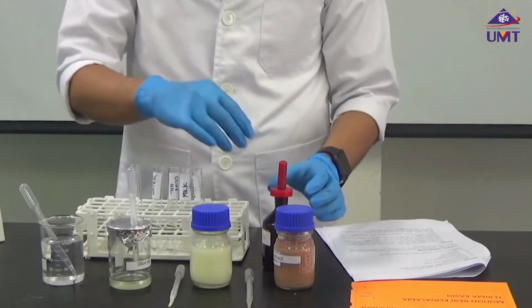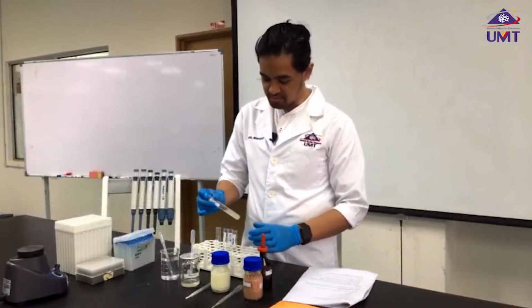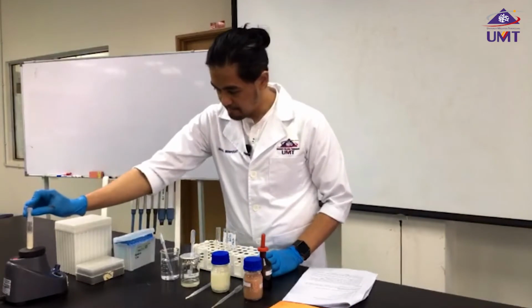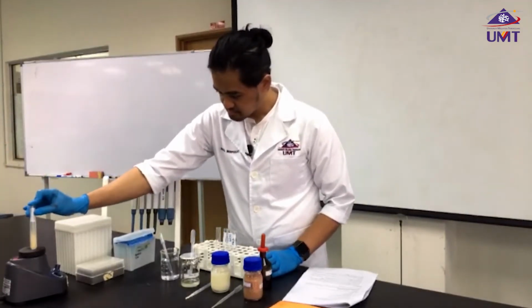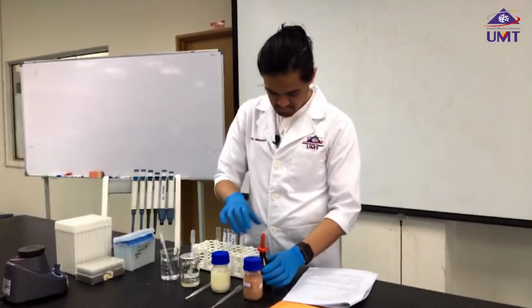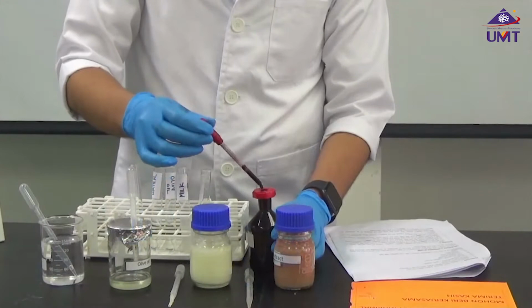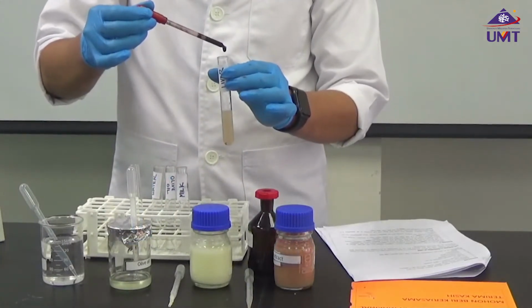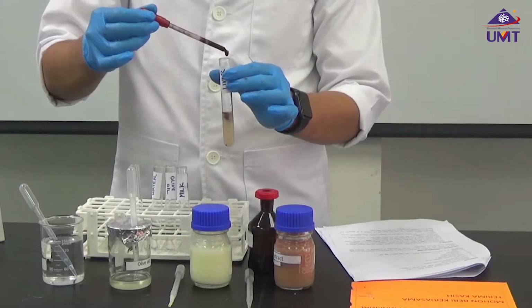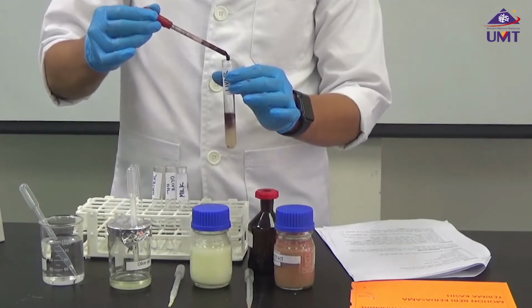And now I'm going to add Sudan 4, but before that I'm going to shake a little bit. Five drops each. 1, 2, 3, 4, 5.